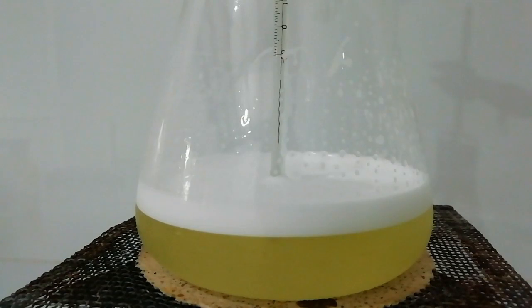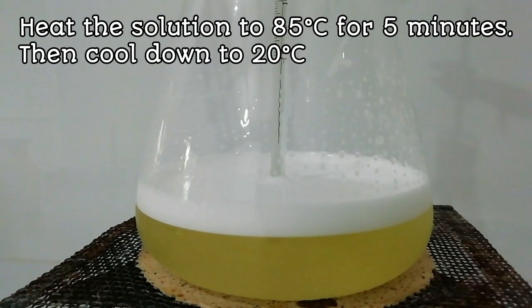Then, the reaction mixture is heated to 85 degrees Celsius for 5 minutes and cooled down to 20 degrees Celsius.